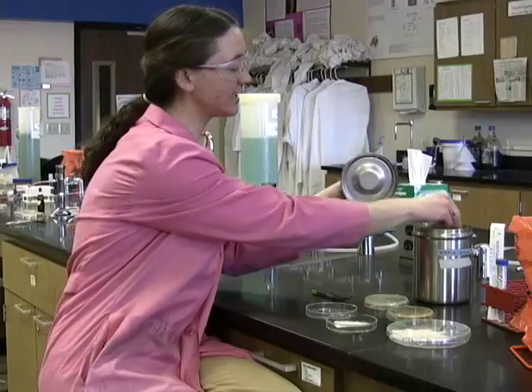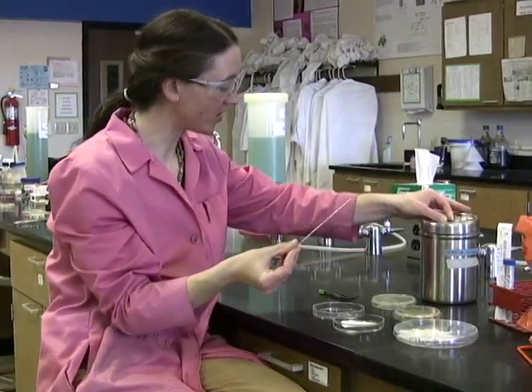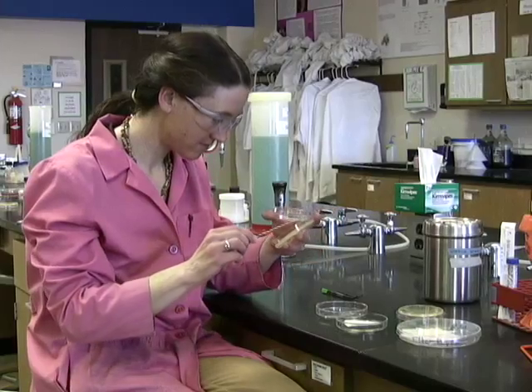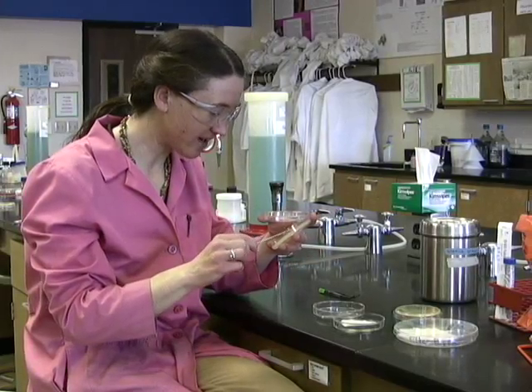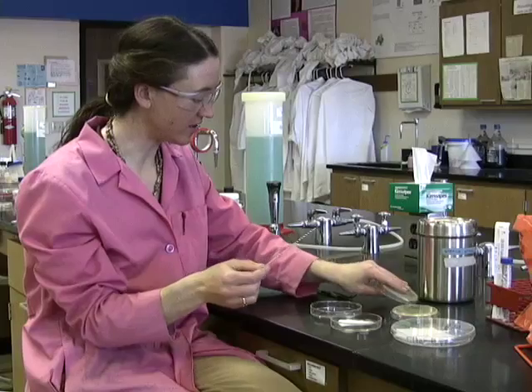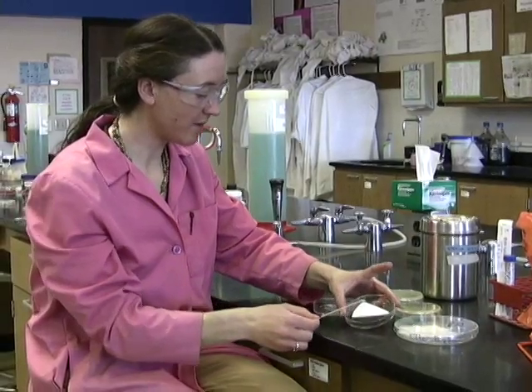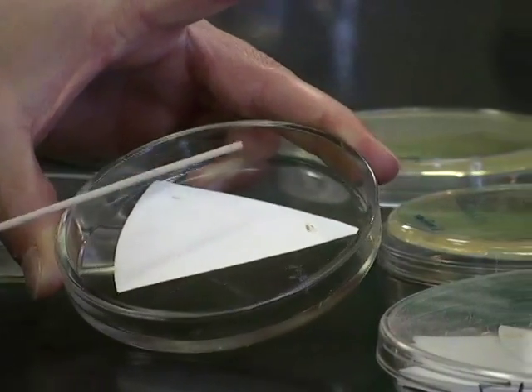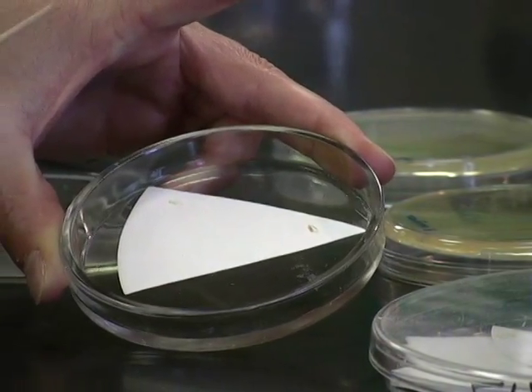So you're going to want to have always a negative control when you do this test as well. Today we're going to use Shigella dysenteriae as the negative control, but you could use any Enterobacteriaceae. So if you wanted, you could use E. coli or Proteus, or even Yersinia pestis. And again, just take enough that you can actually see it on your stick, and again, rub it onto your filter paper. You'll want to put it on another corner opposite of where you put your Pseudomonas aeruginosa.